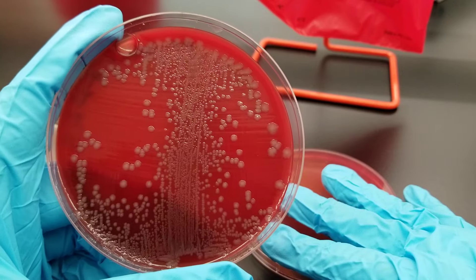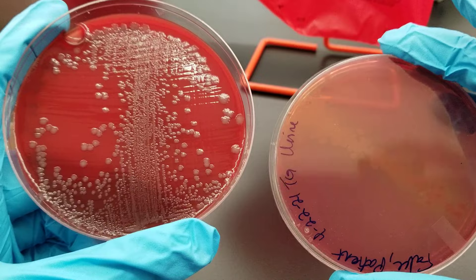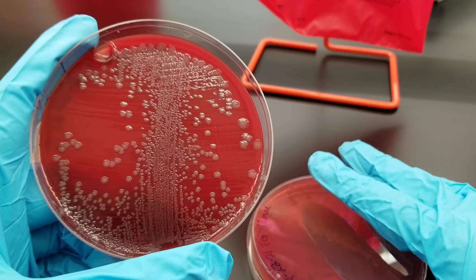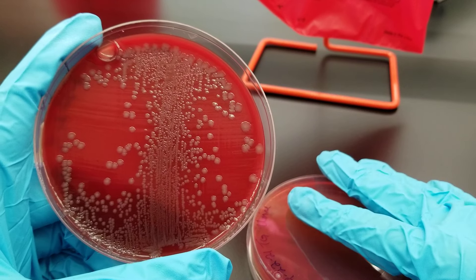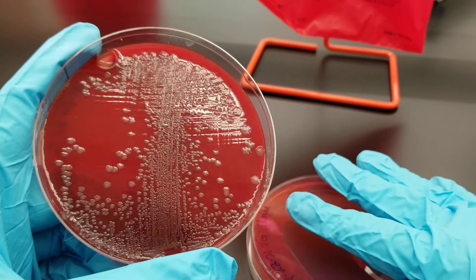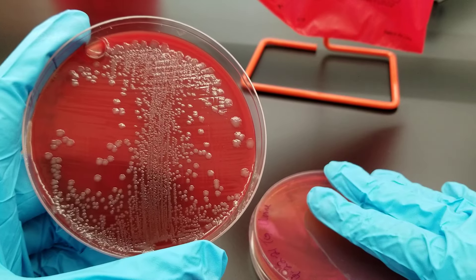I know it's a GNR. We can then do testing from there to identify what the organism is and then determine the susceptibility of that organism with the common antibiotics used to treat a patient. You would also want to make sure that there's no drug resistance — especially on these GNRs.